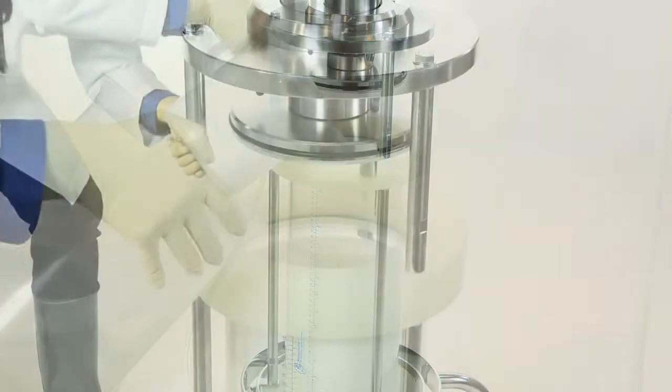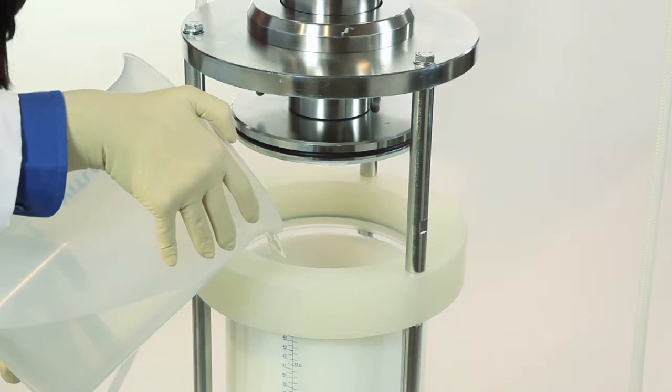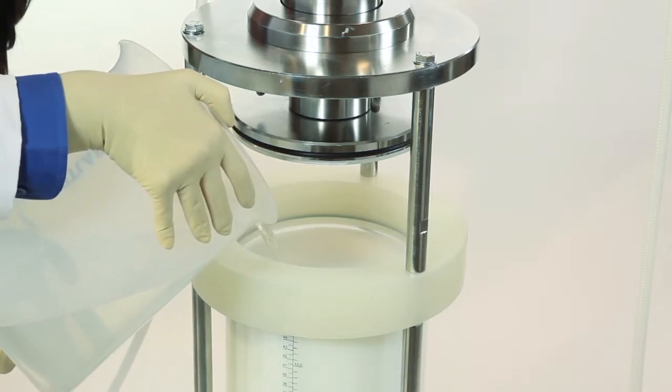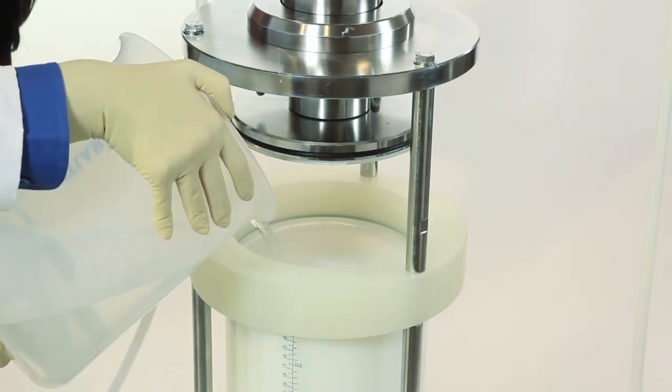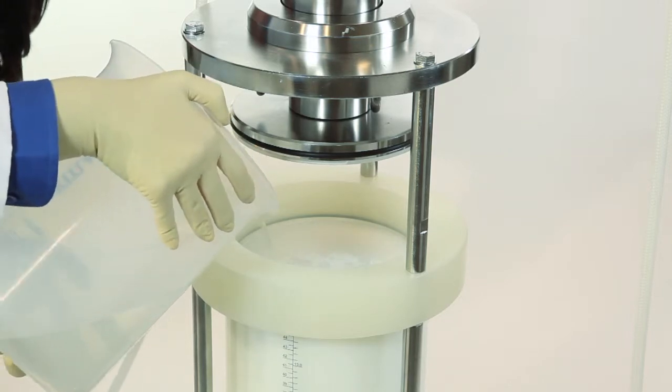Fill the liquid level with water or buffer to the O-ring in the top flange. The total packing volume is always constant regardless of bed height to ensure reproducible packing procedures.